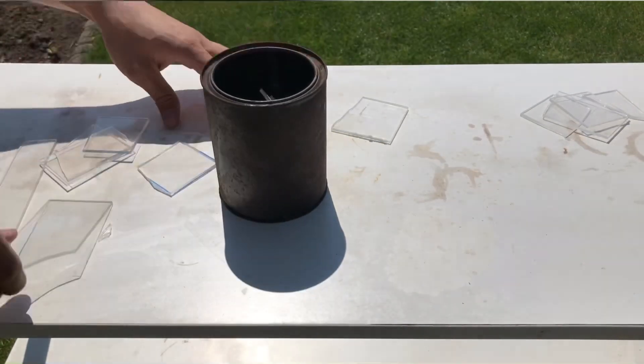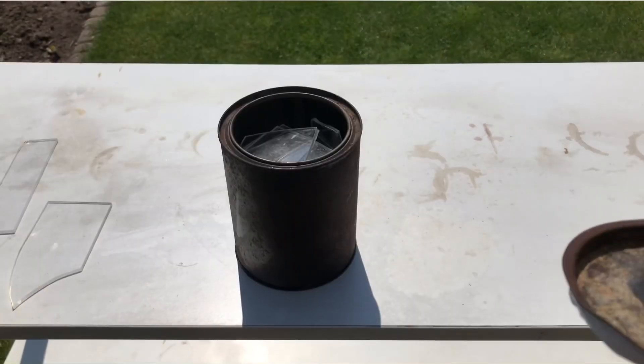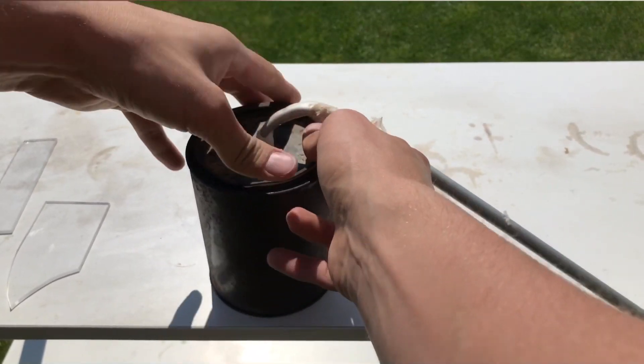To start off, all of the acrylic glass pieces were cut down for convenience and they were added to this metal can as a reaction vessel. With PTFE tape the can was closed, and at the top of the can an aluminium pipe was also connected using PTFE tape.